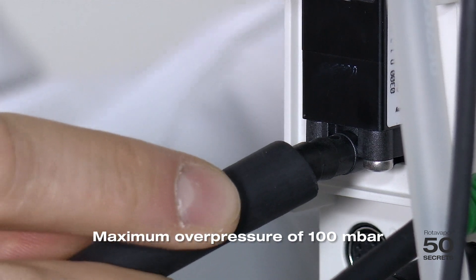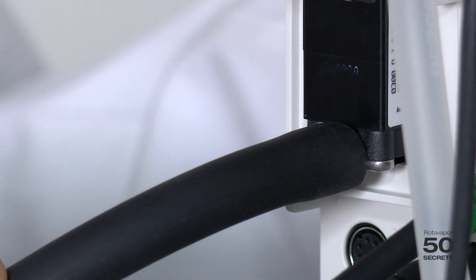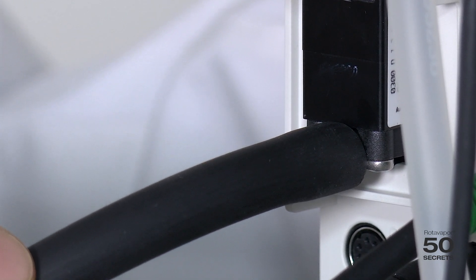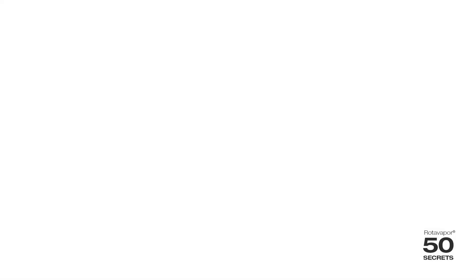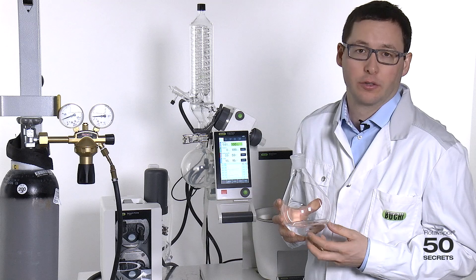Let me first connect the hose which is connected to the nitrogen bottle. Make sure that the pressure of the nitrogen bottle is not beyond 1.1 bar. Let me show you how the process of distillation under inert condition works.